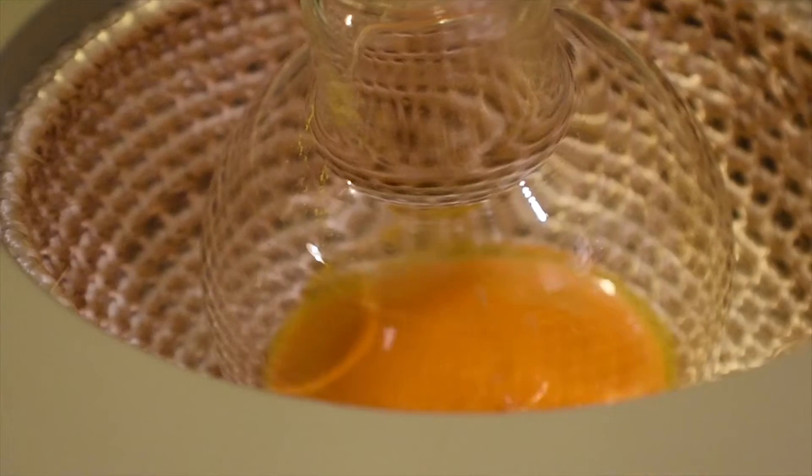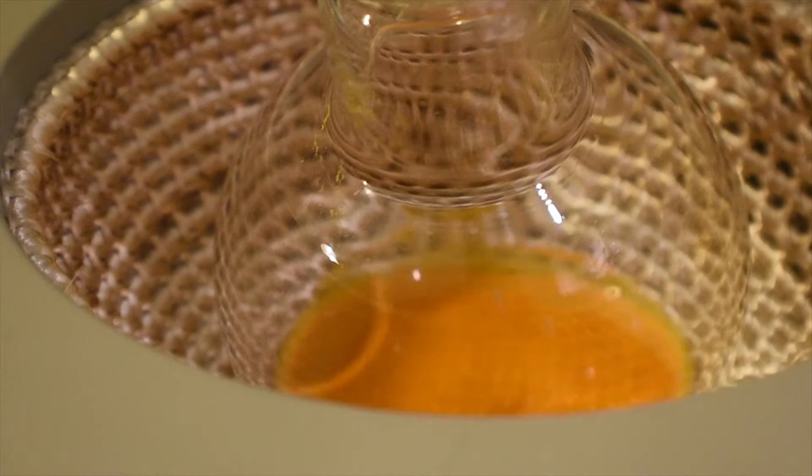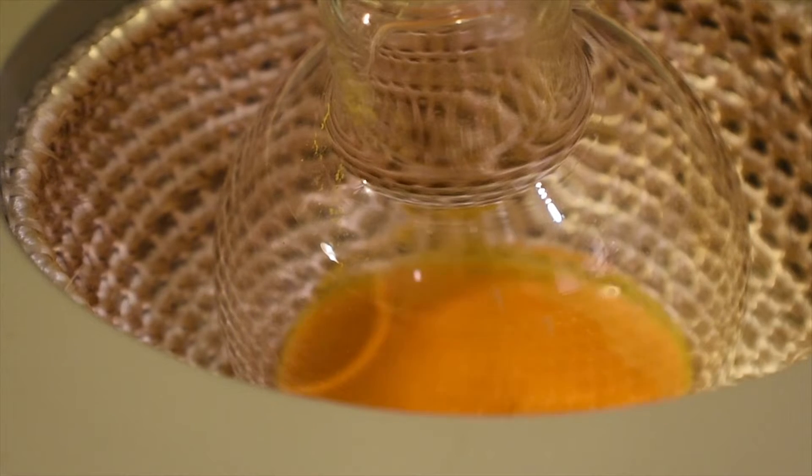You're going to see a color change from the orange of the Vanadium Pentoxide to a darker color, sort of like a green. That's because the color of the vanadyl ion is usually a blue, but when it mixes with the yellow of the Vanadium Pentoxide, it creates sort of an orangey green. I'll go ahead and finish the reflux, let it cool down, and continue with the synthesis tomorrow morning.